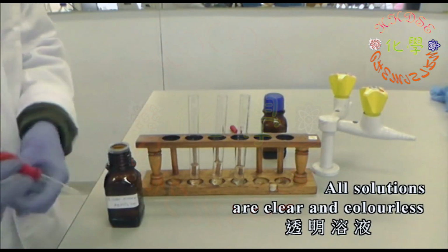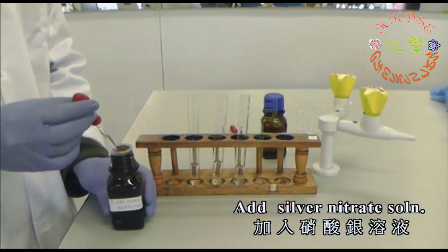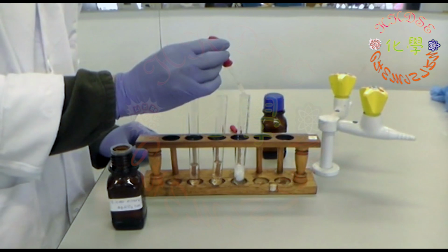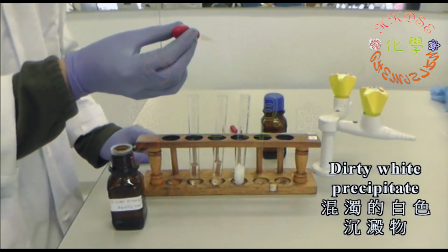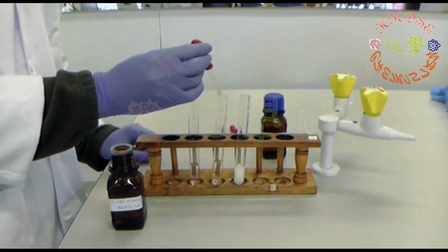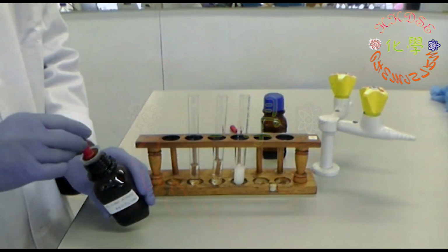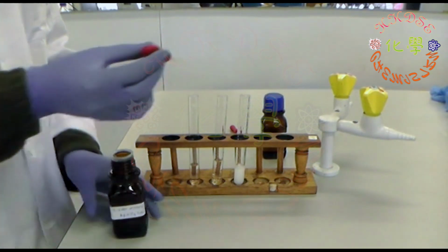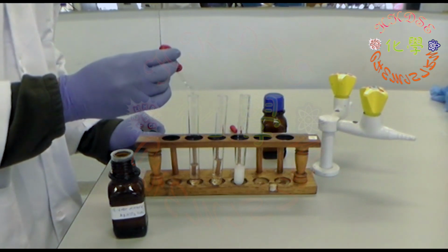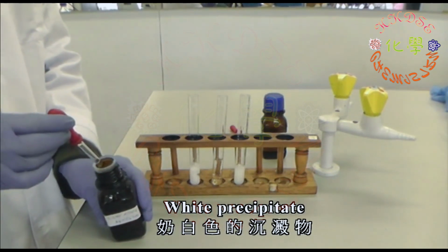The salt in each test tube is dissolved in water to become a clear and colorless solution. After adding silver nitrate solution to the sodium carbonate's test tube, a dirty white precipitate appears. After adding silver nitrate solution to the sodium sulfate's test tube, the solution remained clear and colorless. And after adding silver nitrate solution to the sodium chloride's test tube, a white precipitate appears.